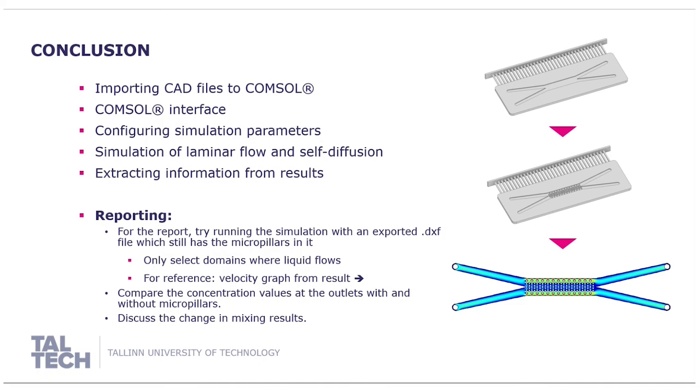For reporting, try to run the simulation with the micropillars left in the extracted CAD drawing file. Keep in mind to select only domains where liquid is flowing. On the right for reference, you should expect something like this for the velocity graphs. Compare the concentration values at outlets with and without micropillars, and discuss the change in mixing results.